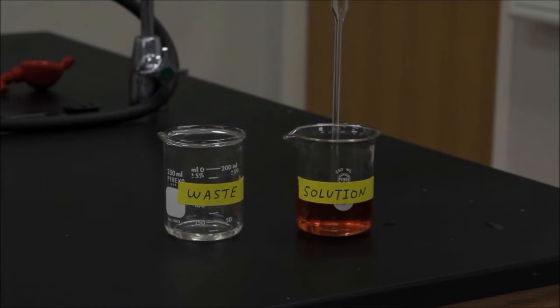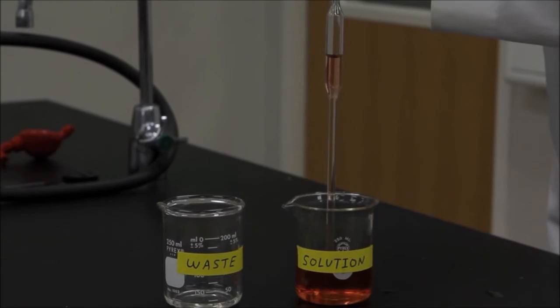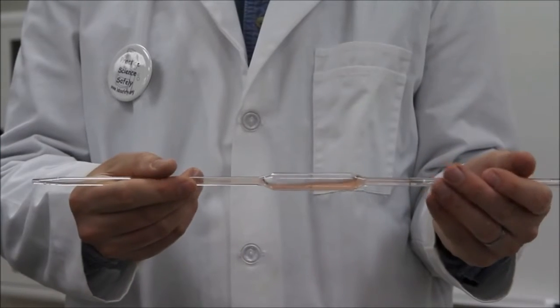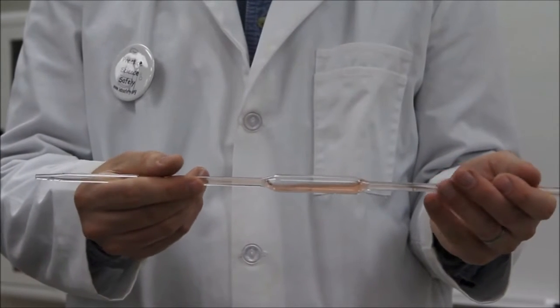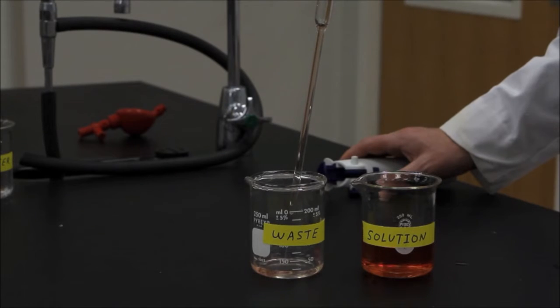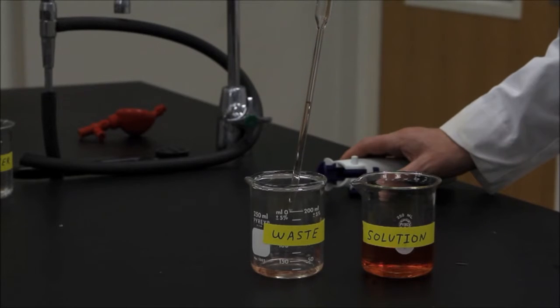Next, rinse your pipette with your solution in a process otherwise identical to the cleaning step. Repeat the rinsing step two additional times with more of your solution.